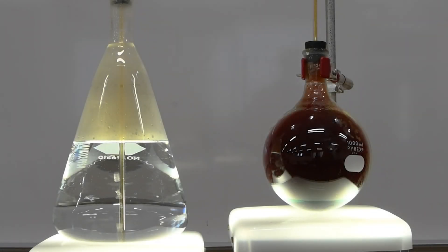It looks like the bubbling is just about done, and the reaction has finished.